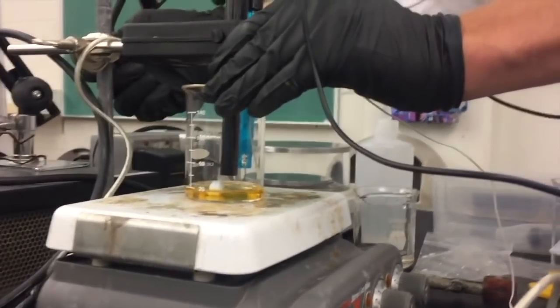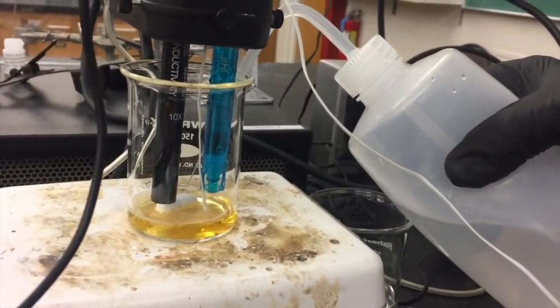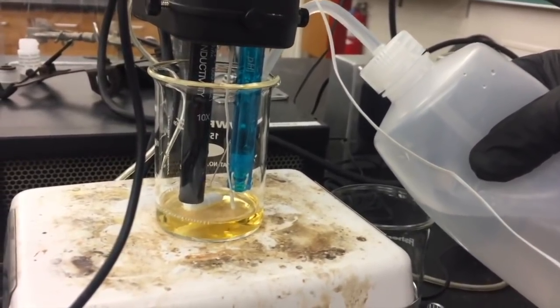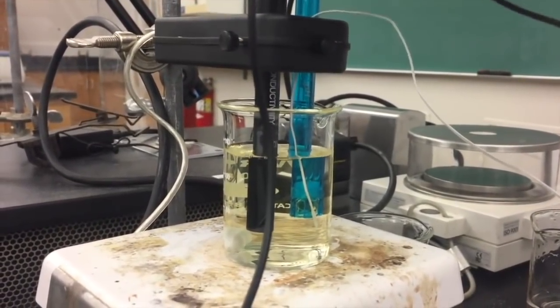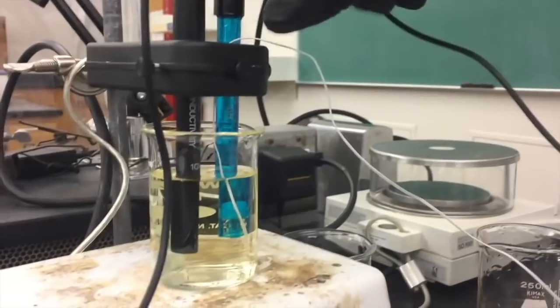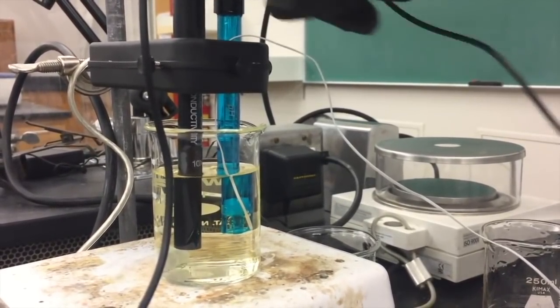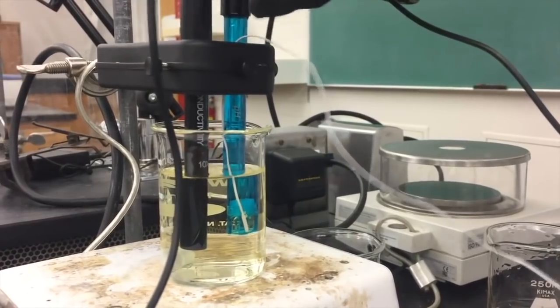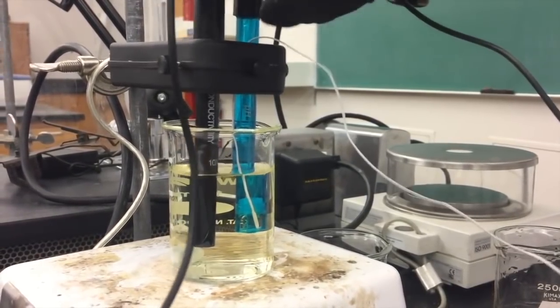Then add enough distilled water to cover the holes on the side of the conductivity meter. At this point you'll want to make sure there are no bubbles in the holes on the conductivity meter. There are always bubbles. You can loosen the screw and gently shake the meter up and down or twist it while it is submerged until all the bubbles are gone. Then you can retighten the screw and hold the meter in position. If you don't get rid of the bubbles usually the conductivity won't record.